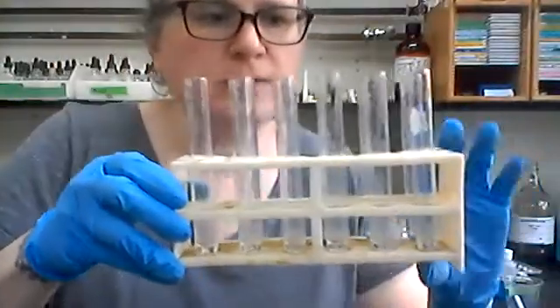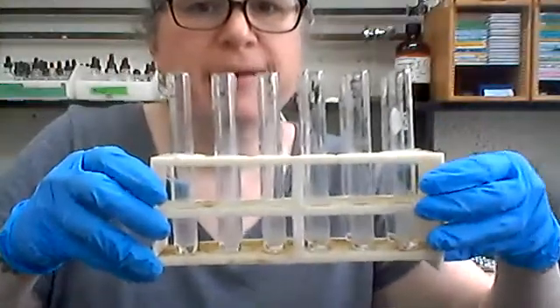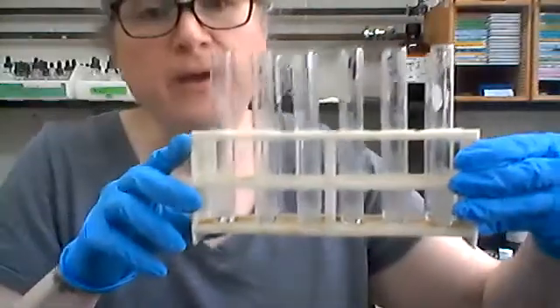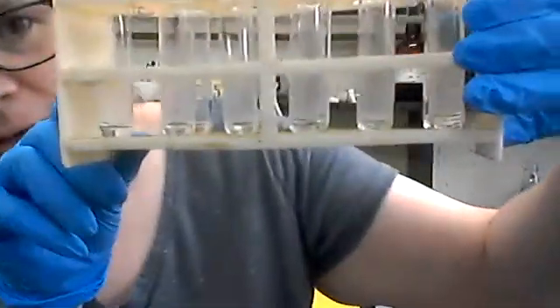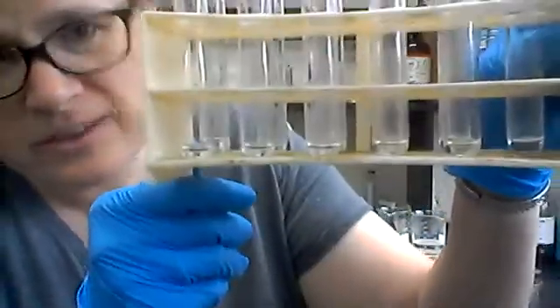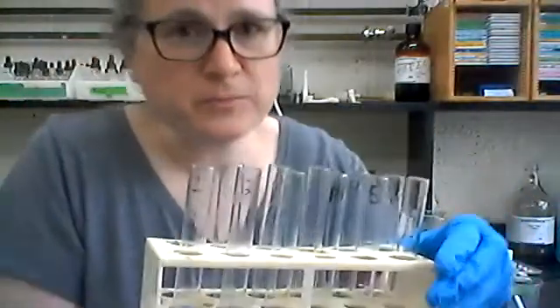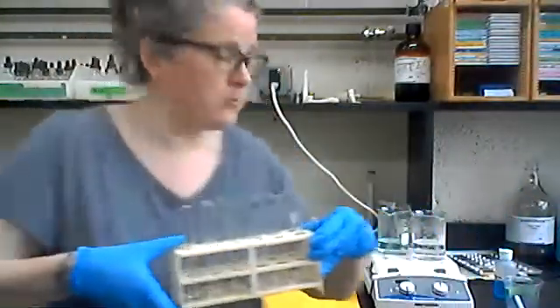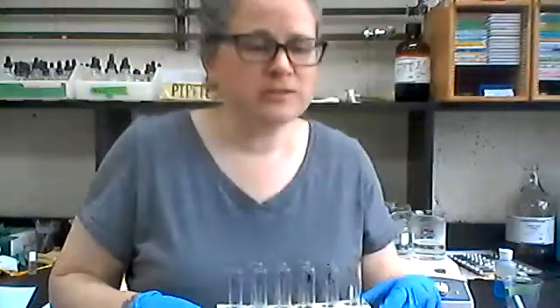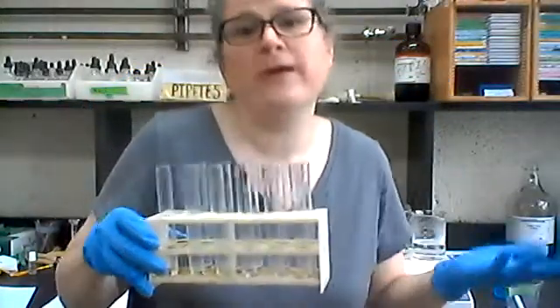Okay, so I just pulled all of these Lugol's iodine out of the hot water bath, and you may notice they are all now perfectly clear. They look like they have water in them at this point. So this one's a little different. The others, we boiled them and saw a reaction. This one, we saw the color change initially. This one, we boiled them and we saw the color go away.